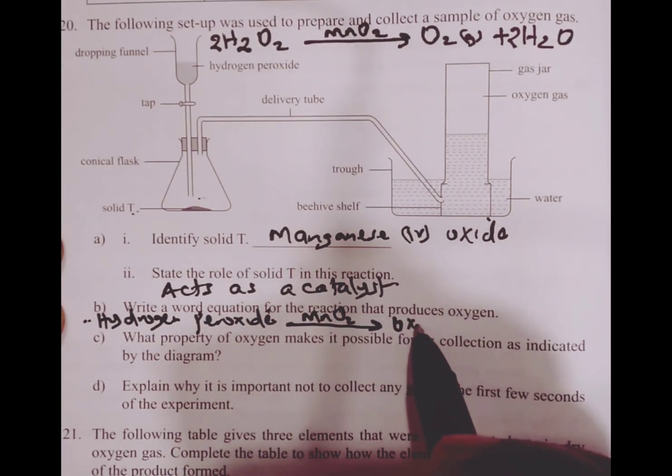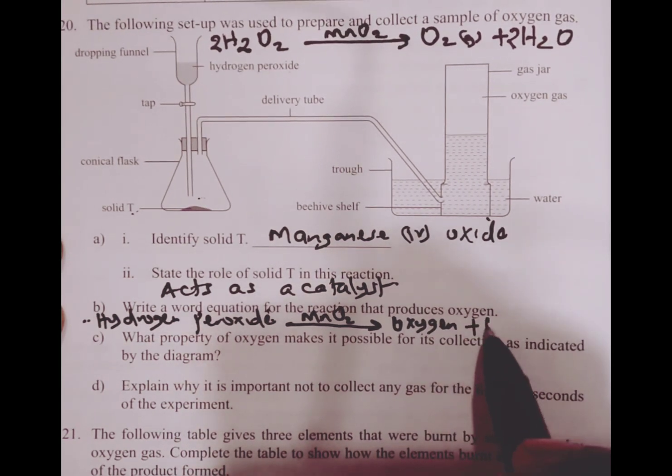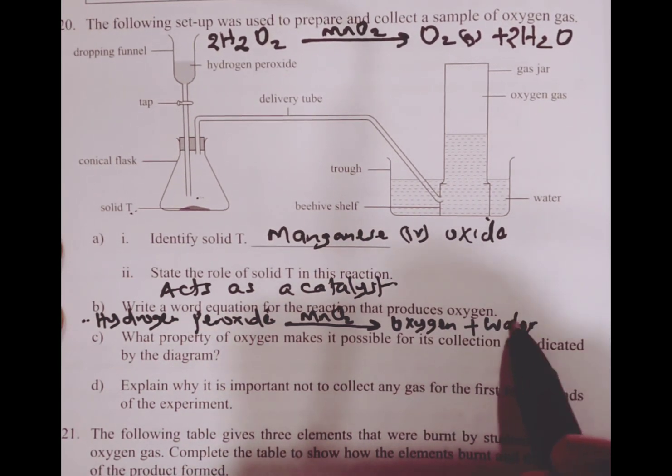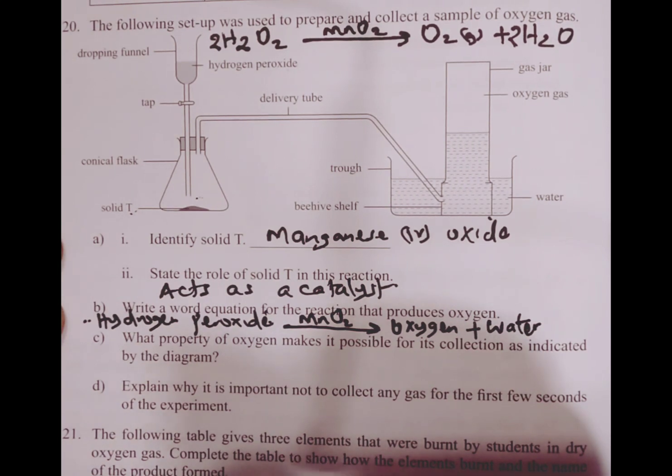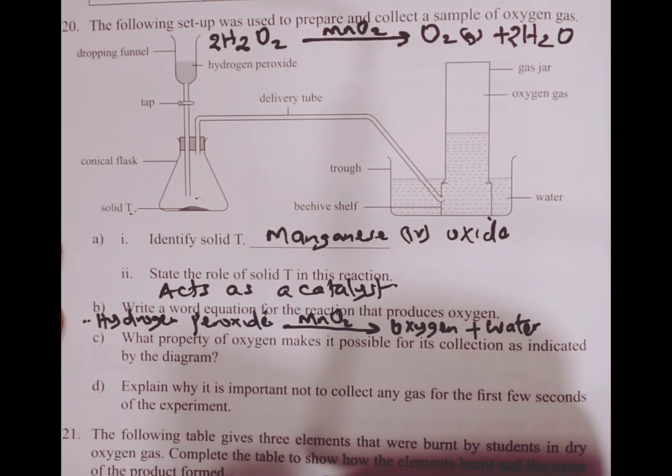to give us oxygen gas and water. These are the products for the decomposition of hydrogen peroxide.